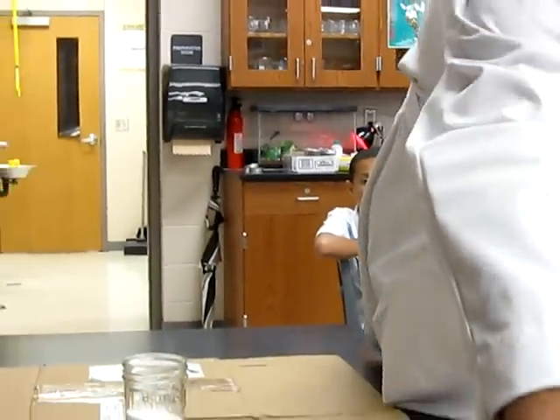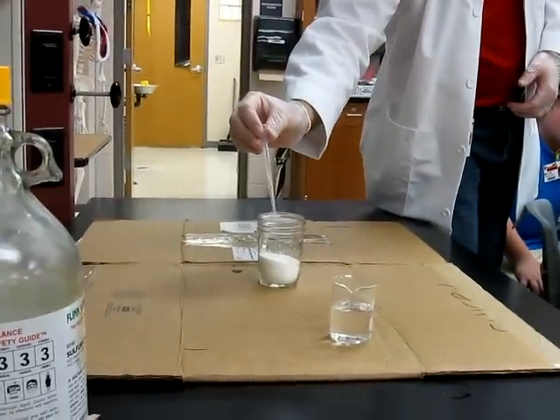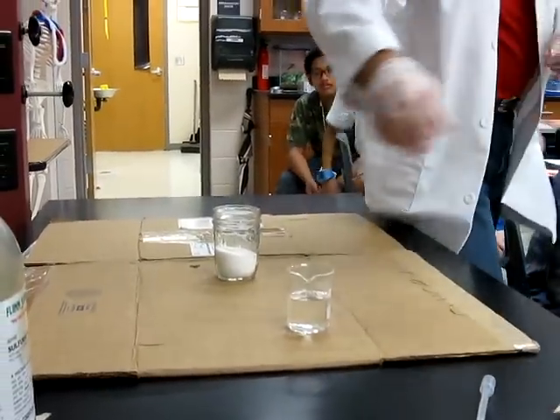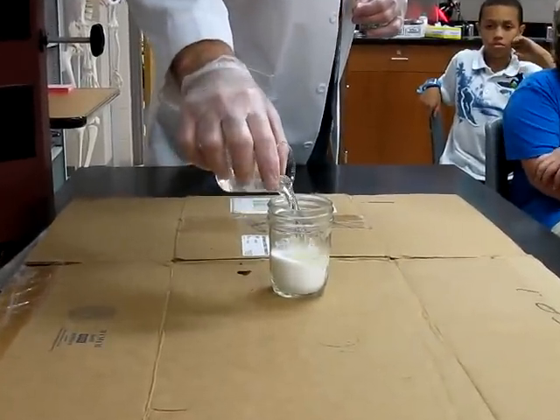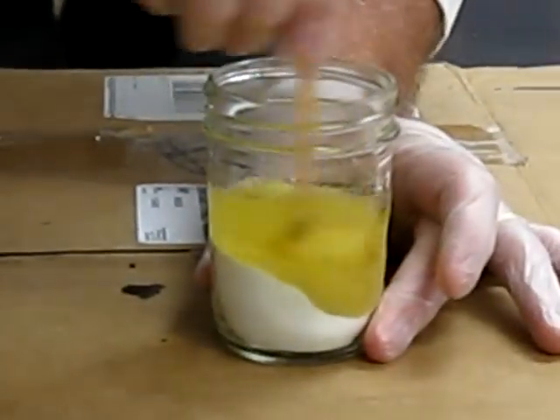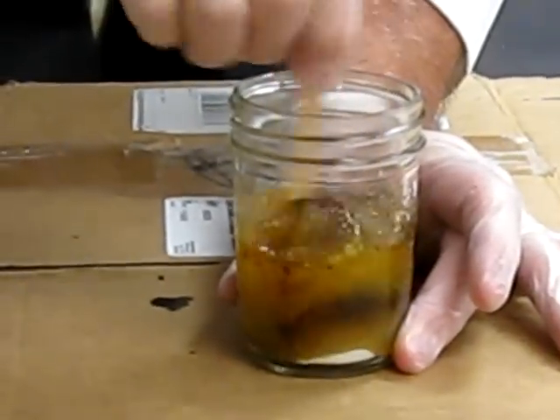The first thing we're going to do is just take a little bit of water to kind of start the reaction. Put a little bit of water in there. Then we're going to take the sulfuric acid and put it in there. Now I want you to check and see if you see some evidence of a chemical reaction taking place.